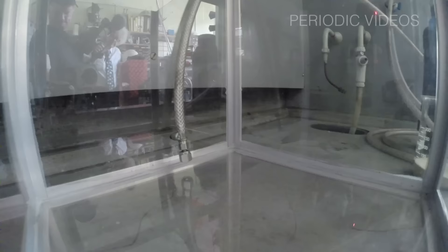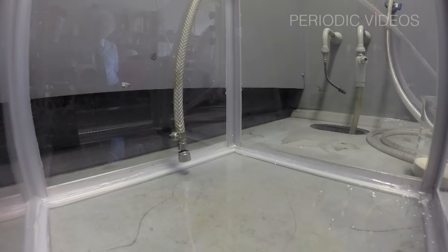So, after discussion with Neil, we decided that the best thing to do was to use an ordinary beaker and to put it in a plastic box, the one he'd carefully made, and try and fill the box with either oxygen or nitrogen, which would not condense.